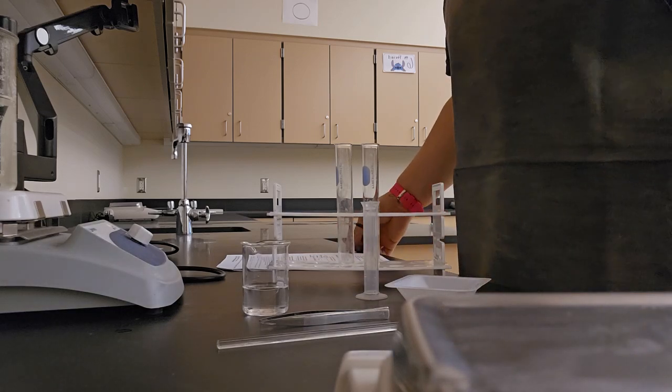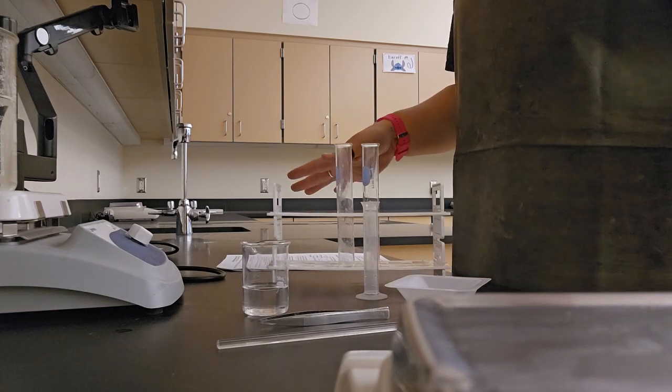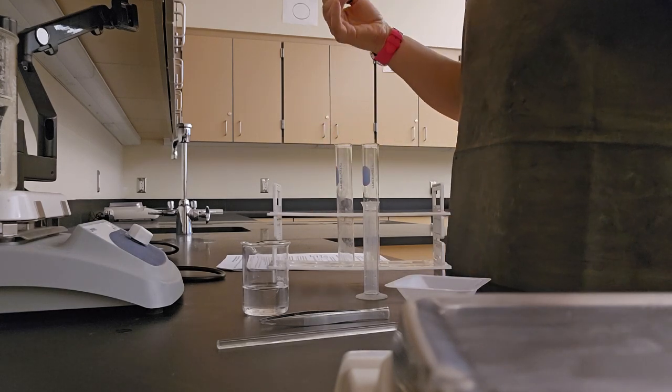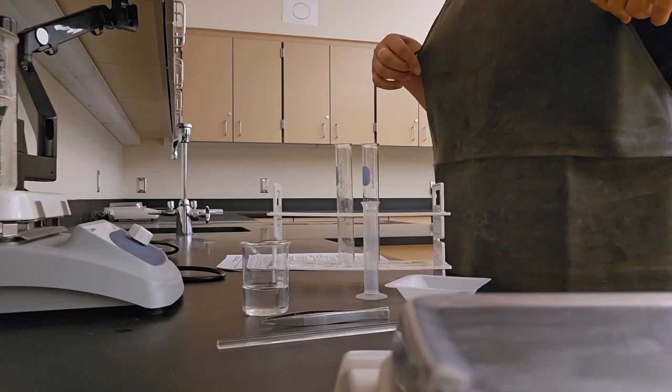Welcome to our Enzymes Lab. We're going to jump into part A. I've already completed the pre-lab. I have part A, gotten dressed for lab, completed step 1.